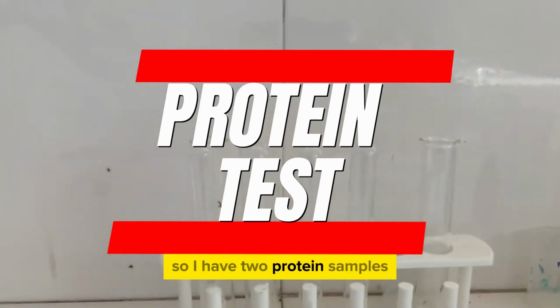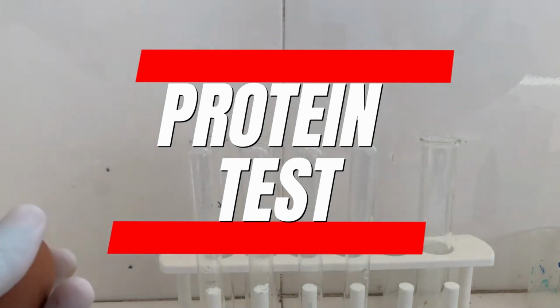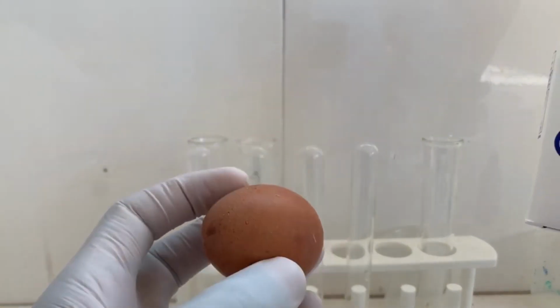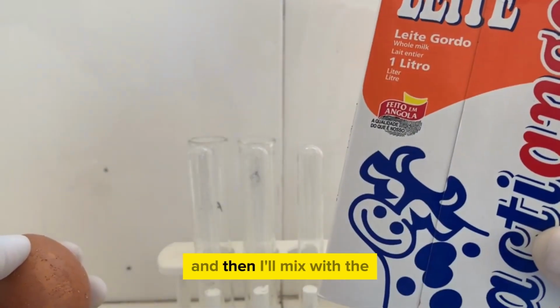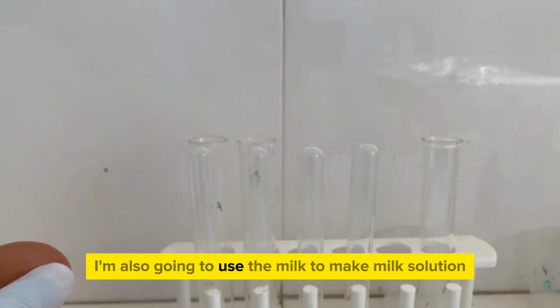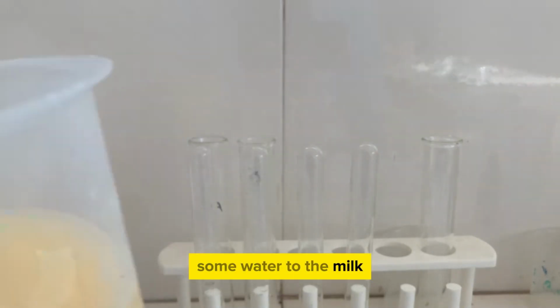So I have 2 protein samples, my egg and my milk. Firstly, I'm going to make an egg solution. What I'll simply do, I'll break the egg and add it into some water in a beaker, and then I'll mix with water. I'm also going to use the milk to make milk solution. I'll simply add some water to the milk.